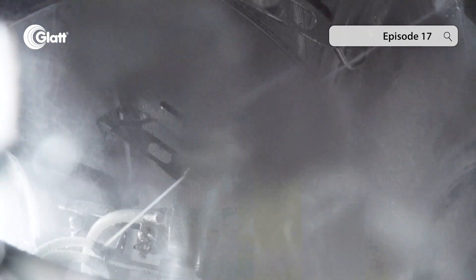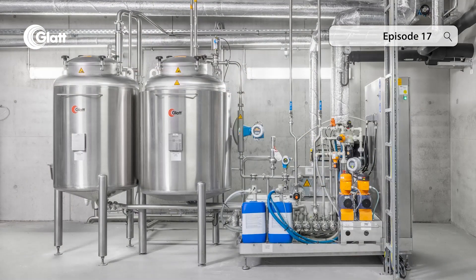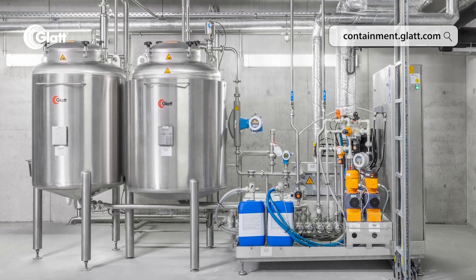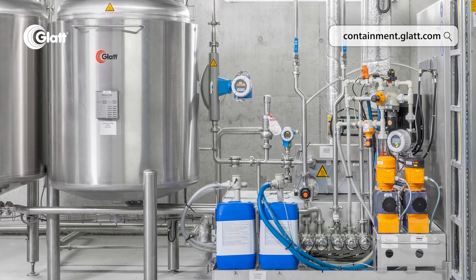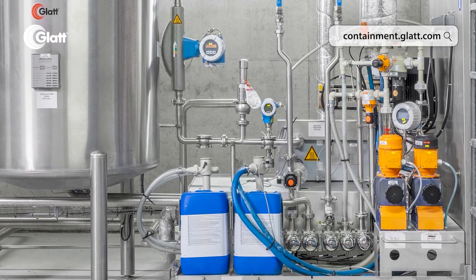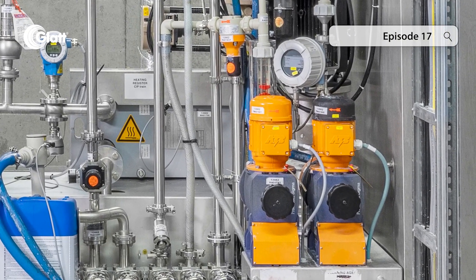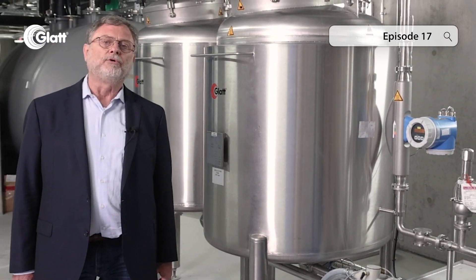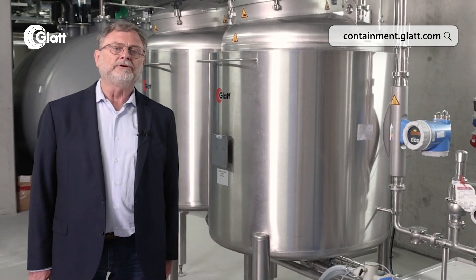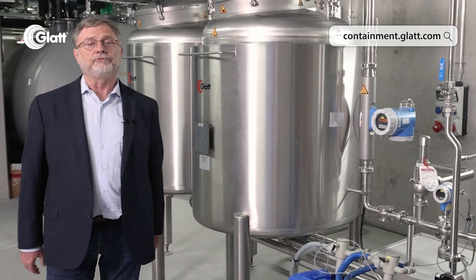The automatic part of a plant cleaning is recipe controlled in the cleaning process. The cleaning medium is provided by such a cleaning station. Here, the various media — cold water, warm water, purified water, and compressed air — are brought to the required flow rate and temperature, and detergents needed for the cleaning process are added through dosing pumps. The booster pump maintains the required flow and pressure, and in the steam heater the cleaning medium is heated up to the necessary temperature to achieve a good cleaning result.